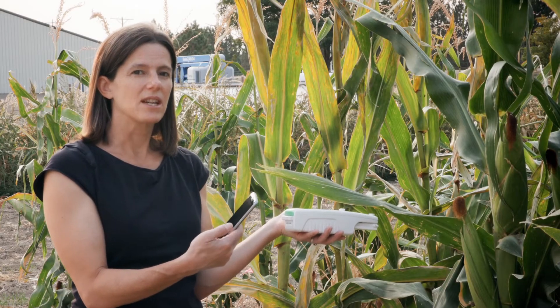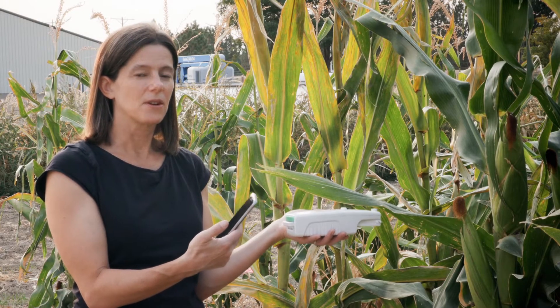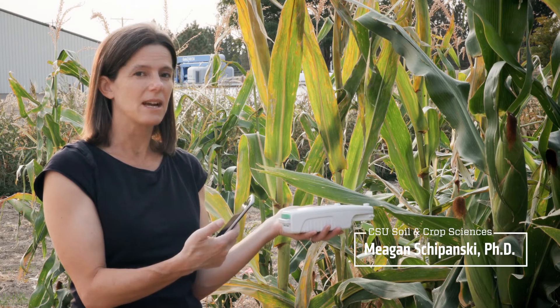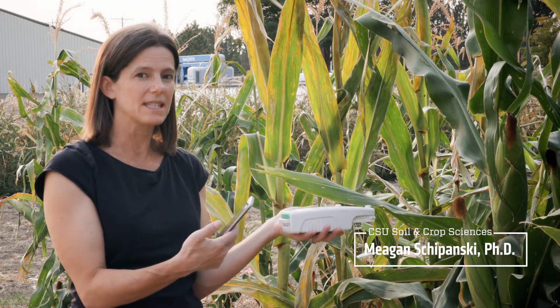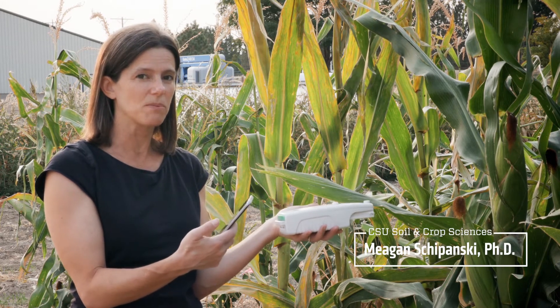We're going to demonstrate how we're going to collect photosynthesis measurements for this lab and provide data that you're going to then interpret.